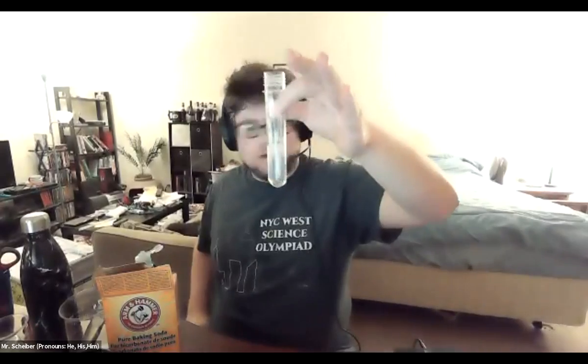Today I'm going to do a chemical reaction for you, a classic one. Inside of my test tube here, I have water, and I'm going to put some baking soda into my water. A couple of scoops of baking soda. Not very precise today. And I'm also going to put a little soap in. Don't actually need the soap for this, but I think it makes it more exciting.